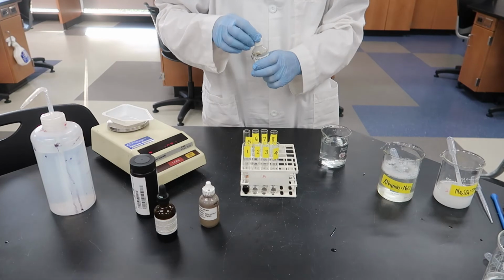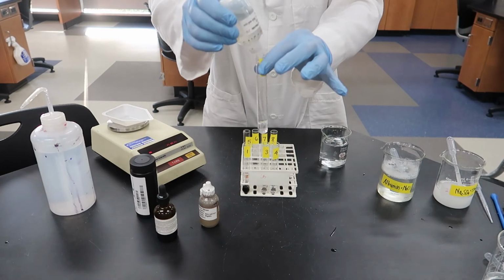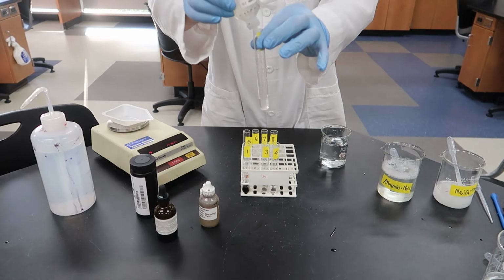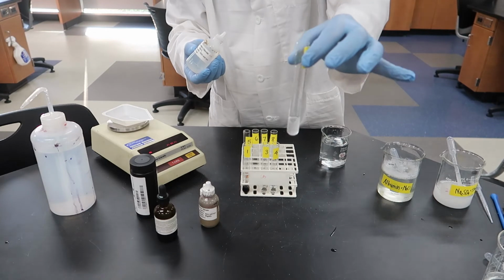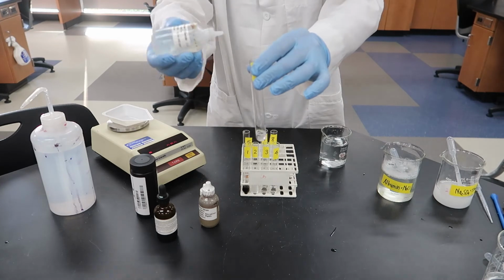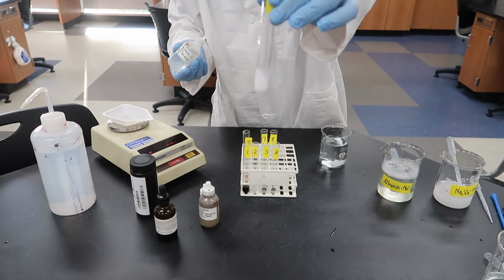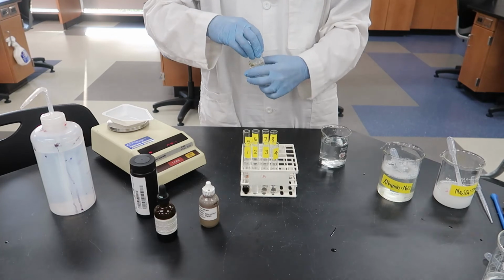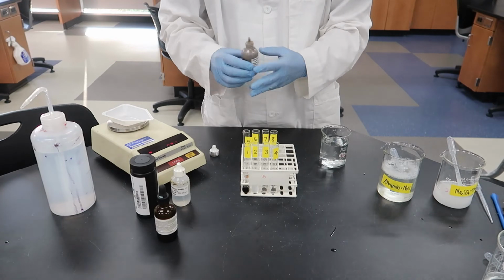Okay, our next one, barium chloride. Put a few drops in 2 and 6. In test tube number 2, it's kind of hard to see what's going on there with my white lab coat, but there we go. You can see it's starting to turn white, so we do have a positive result. It's not a real strong positive result though, but we do have a positive result. And if we add it to test tube number 6, we definitely get a positive result. So for both of those we did get white, but 2 is just kind of weak for some reason.